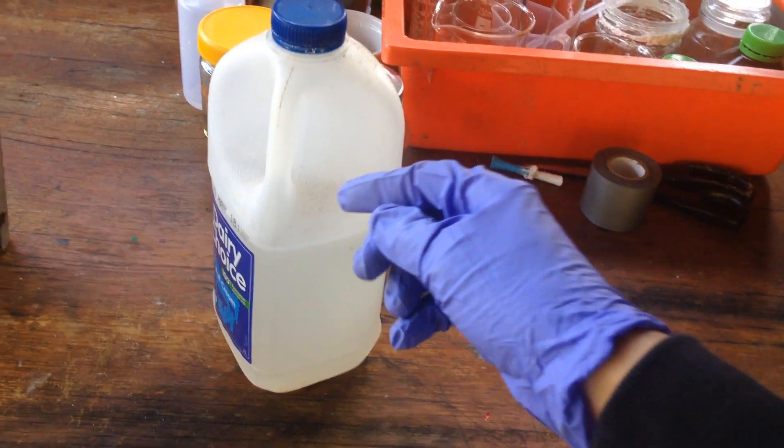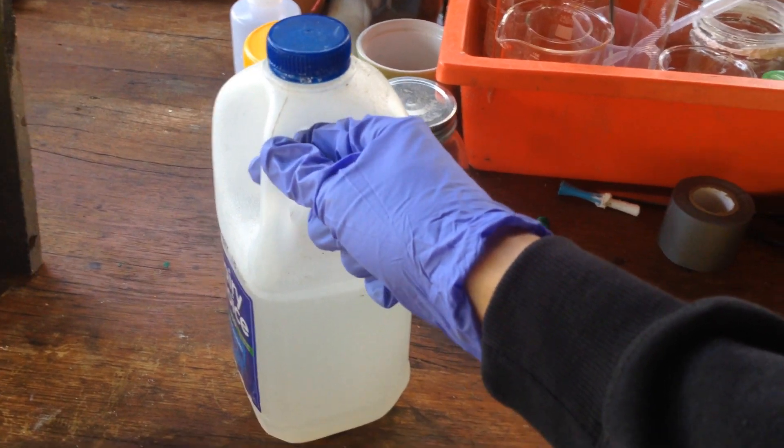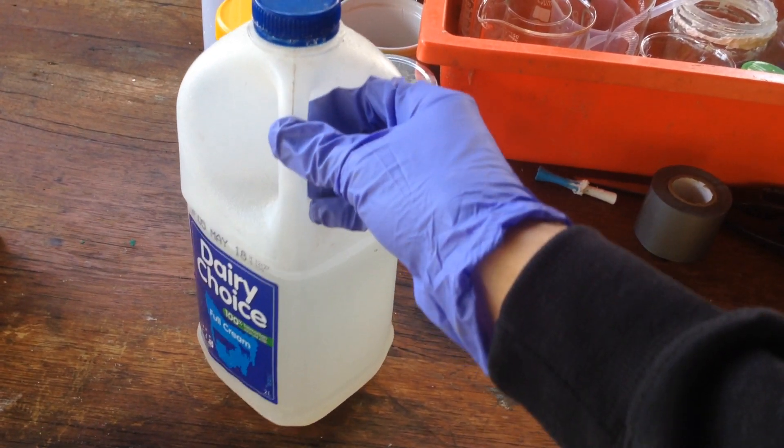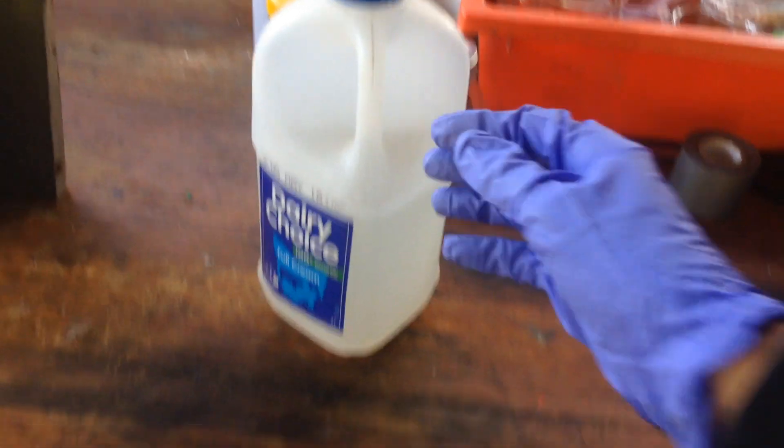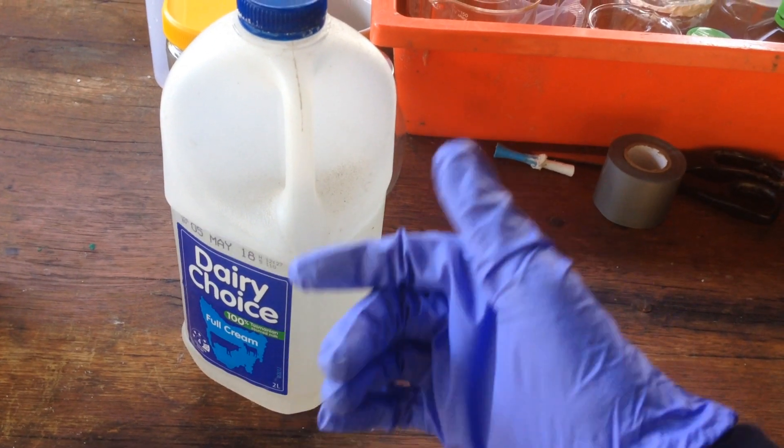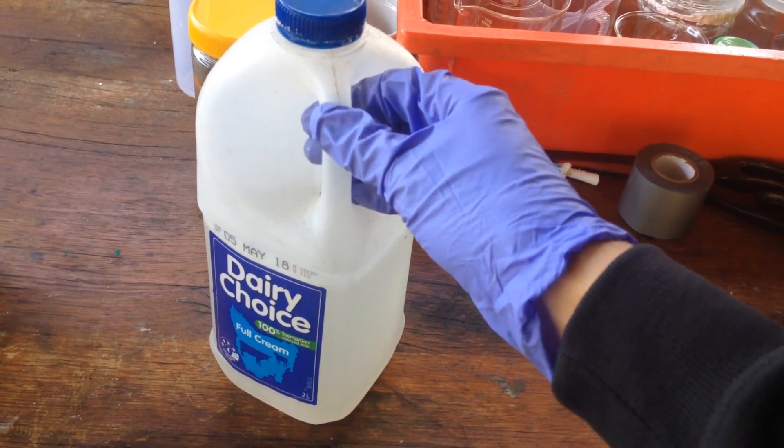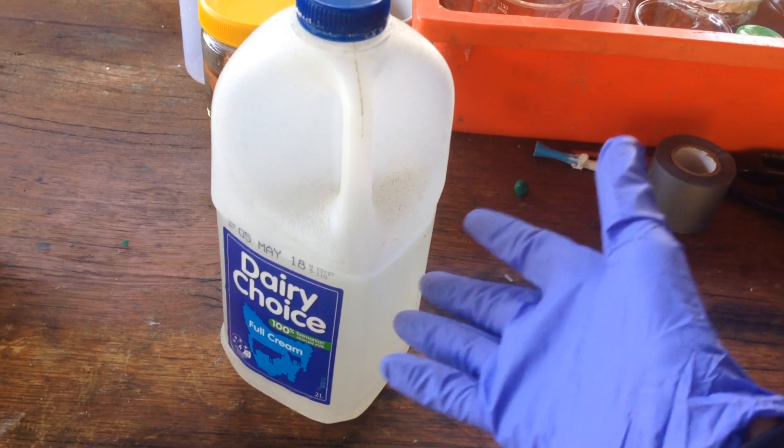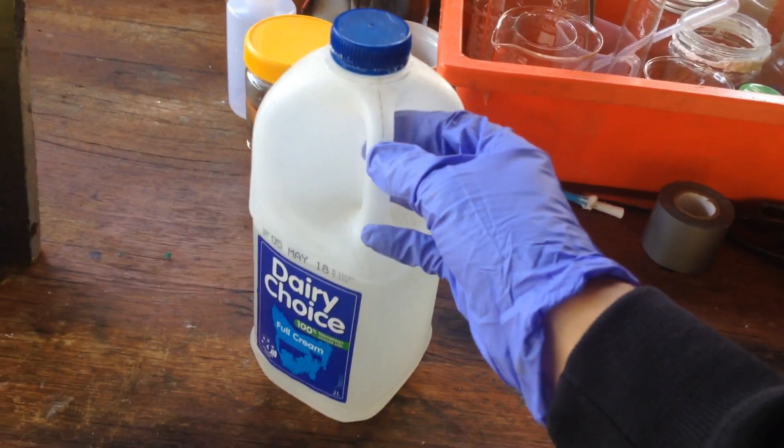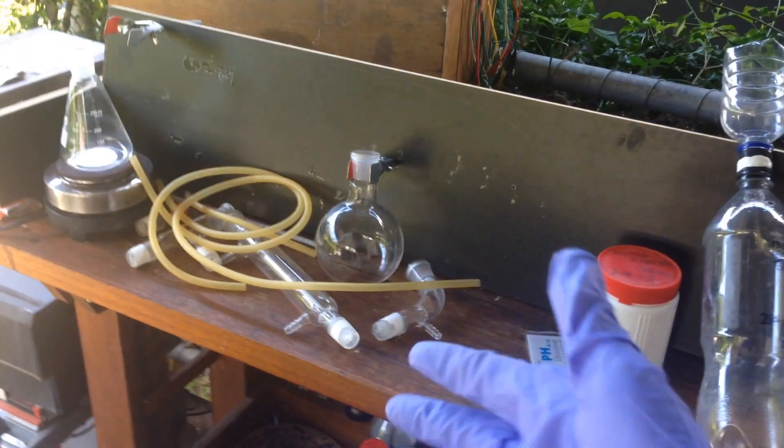What we've got to do now is, because at the very start of the electrolysis runs, I used an acidic electrolyte, and now I'm using a basic electrolyte, and I've just mixed them together. We have sulfuric acid and sodium hydroxide in there, they've neutralized, we've got just sodium sulfate in there, which we need to remove through distillation.